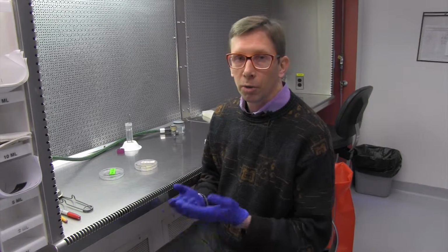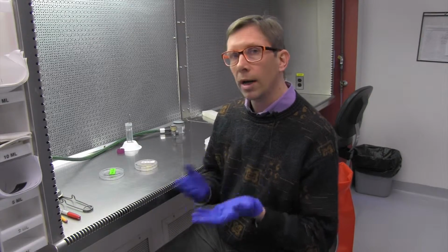Here in the Guiltinan lab, we have a tissue culture pipeline and focus specifically on the Theobroma cacao. The reason why the tissue culture pipeline was developed is because, principally, sometimes cacao is not self-compatible, meaning you can't breed the tree with itself.